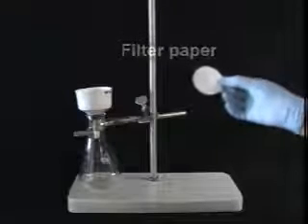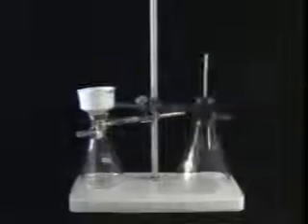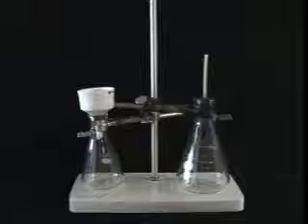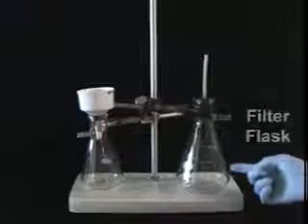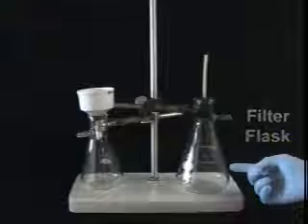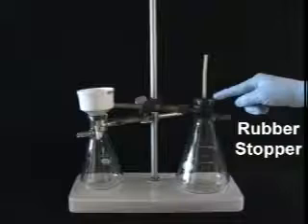The piece of filter paper should be large enough to cover the funnel's base but not fold up onto the sides. Now add the water trap to the setup. Make sure it's firmly clamped to the stand. It consists of a filter flask. Also, notice its sidearm, a rubber stopper.